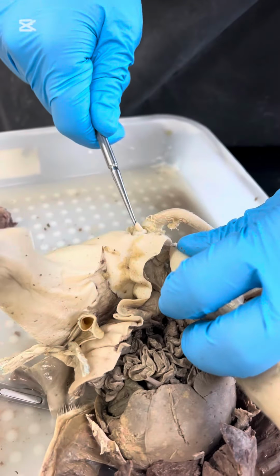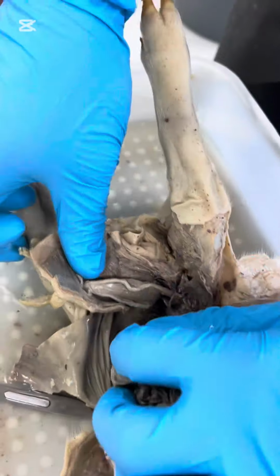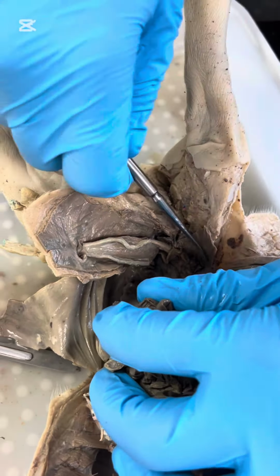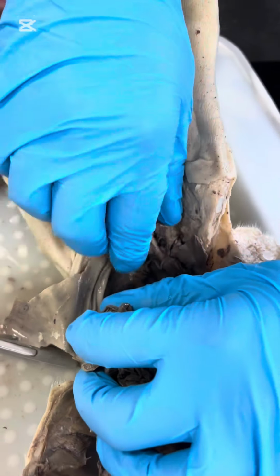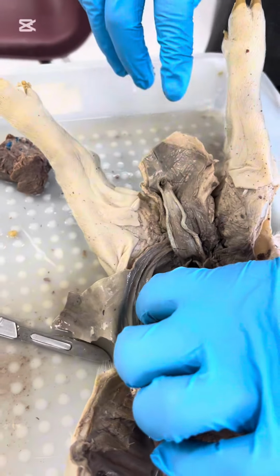On to the female reproductive system. This right here is the top of the female uterine horn. As we move down over here and we pull up the intestines, we can actually see more of the uterine horn down over there, and we can actually see one ovary over there and one ovary over there. Accompanied with the ovaries are the oviducts, which are just to the right and to the left of the ovaries.